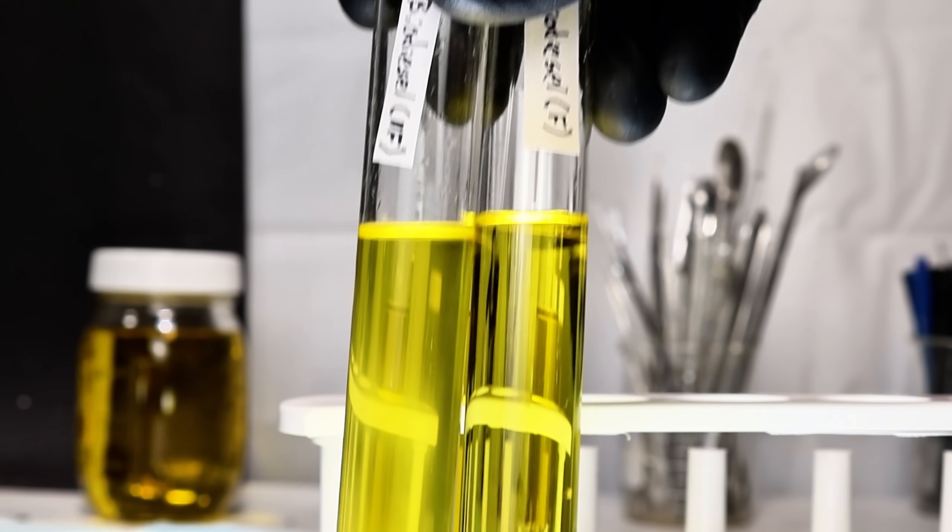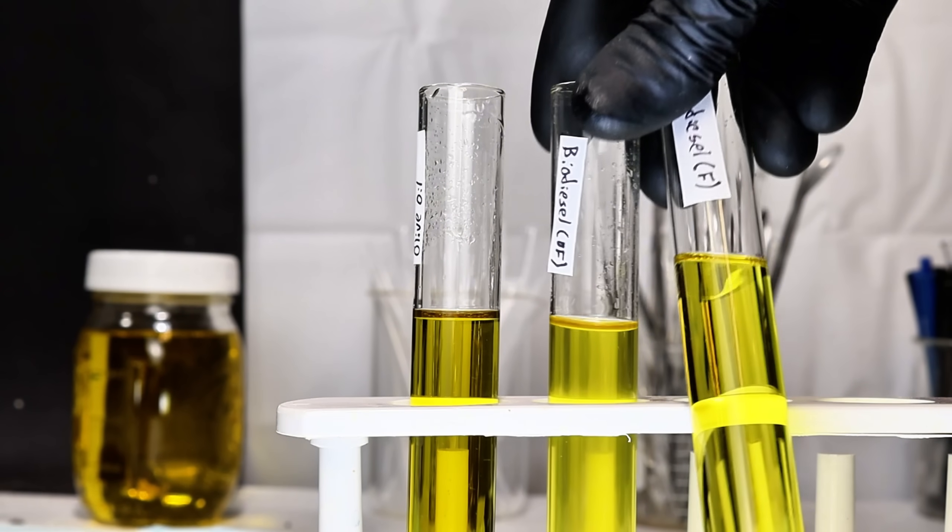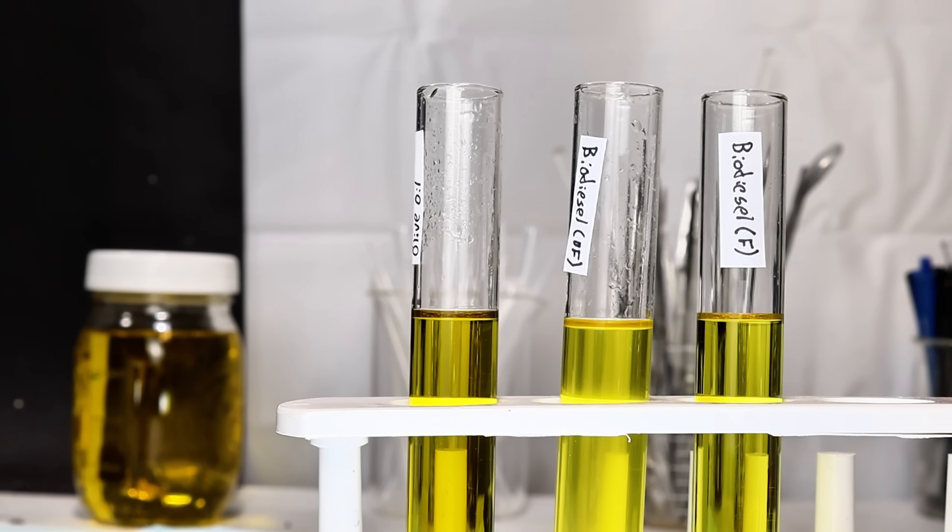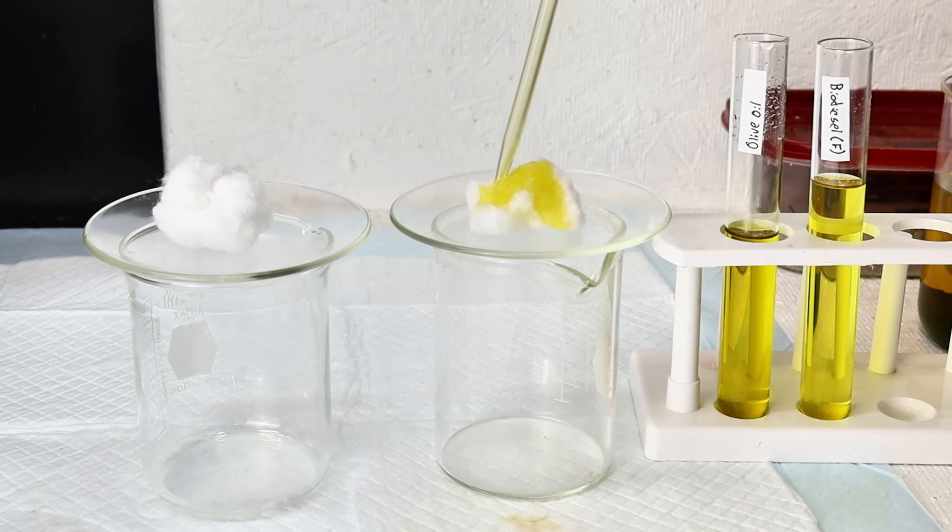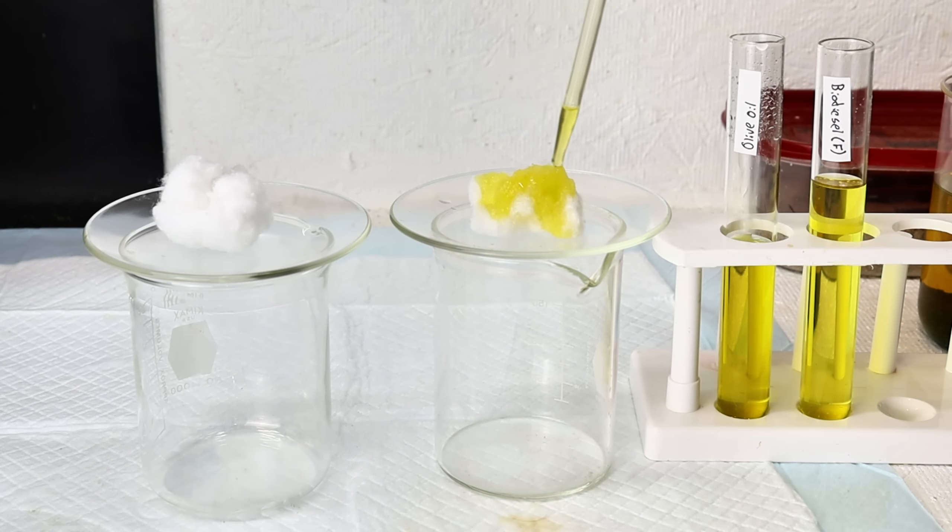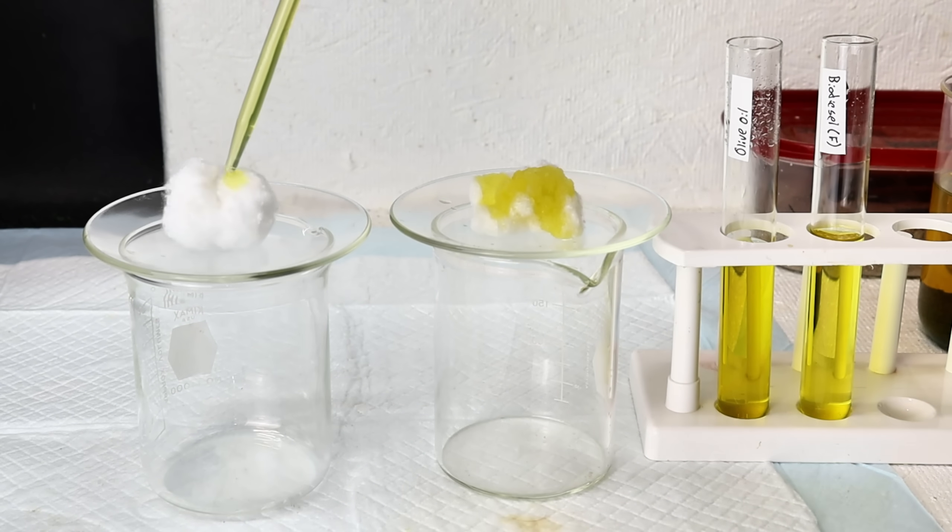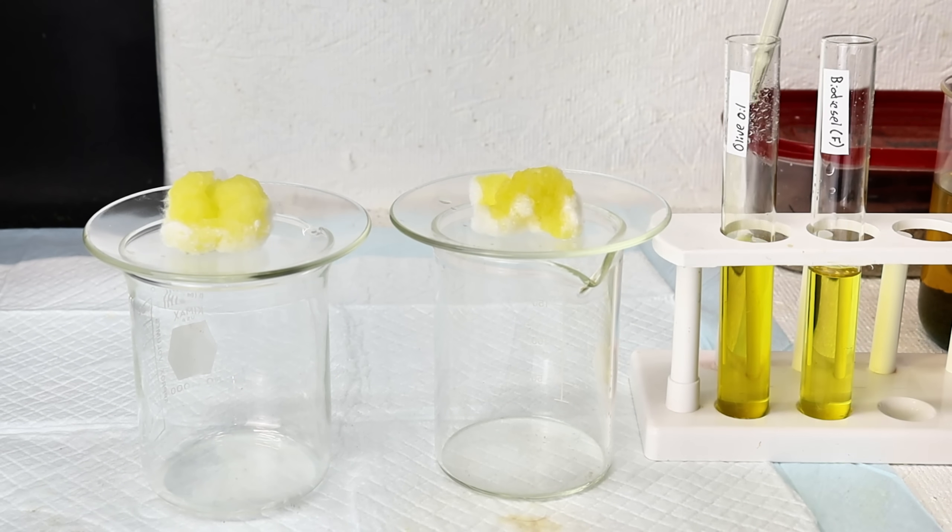As a final demo, I decided to test how the biodiesel performed as a fuel compared to straight olive oil. To do this, I simply saturated two cotton balls, one with olive oil and the other with the biodiesel. I then ignited the biodiesel-soaked cotton ball, and after some difficulty, I did the same with the olive oil-soaked ball.